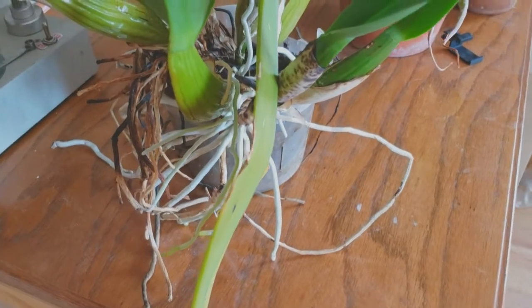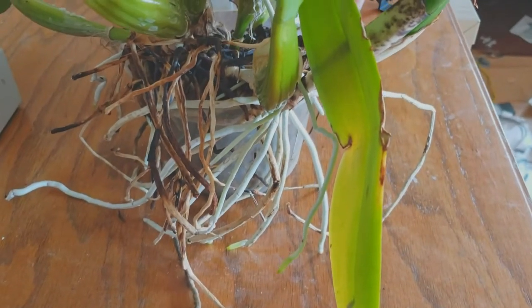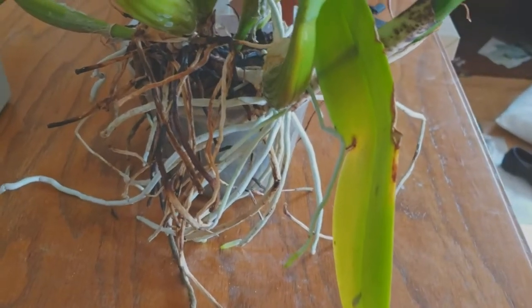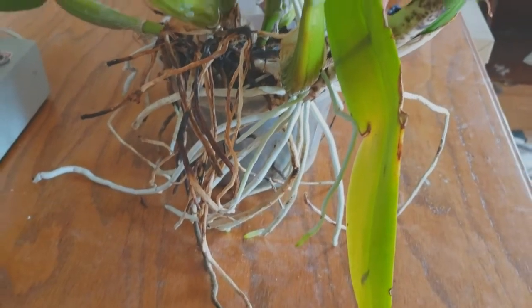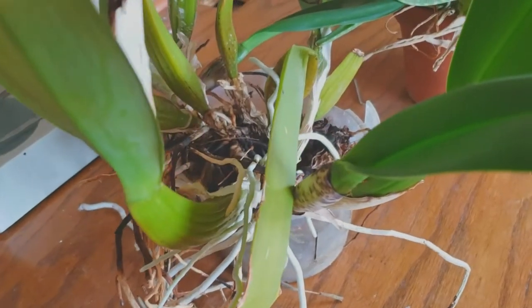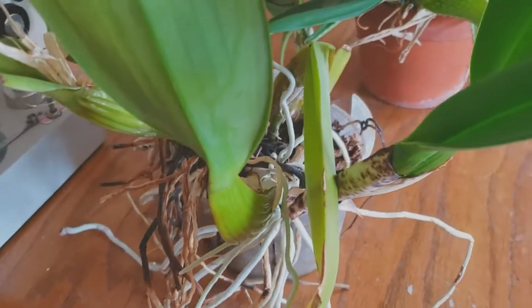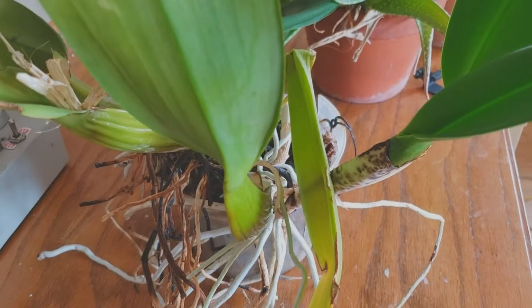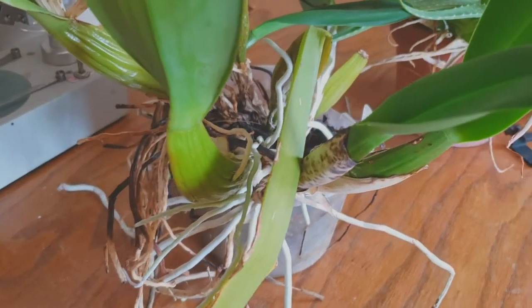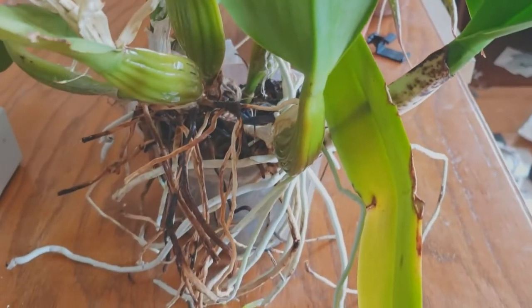Okay, so we've looked at some normal roots. I've showed you guys cross-sections of normal roots that are stained, and I'm hopefully going to make a cross-section of a different root. This right here is a plant. This is an orchid. Now this is a tropical orchid. This is of the genus Cattleya, also known fairly famously as corsage orchids. I actually got this from Lowe's of all places about, I don't know, about 7 years ago or something like that. And it's been blooming and doing pretty well.